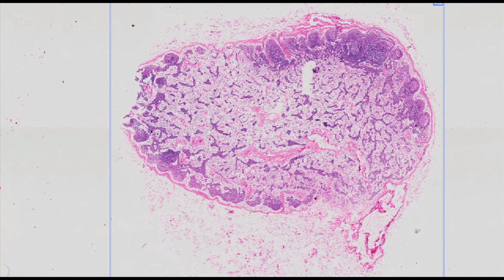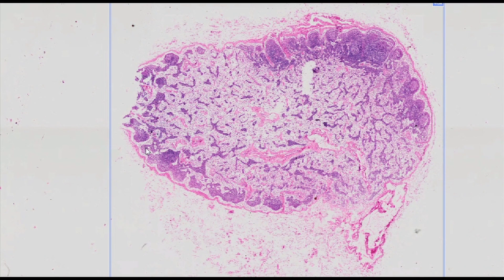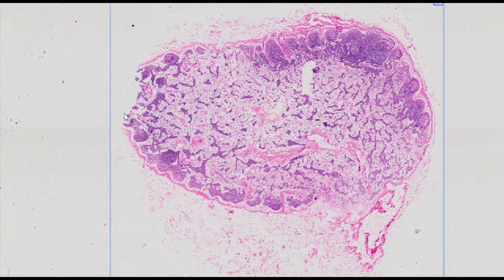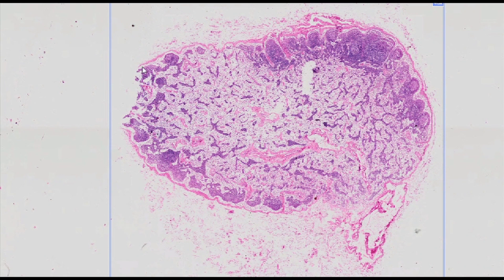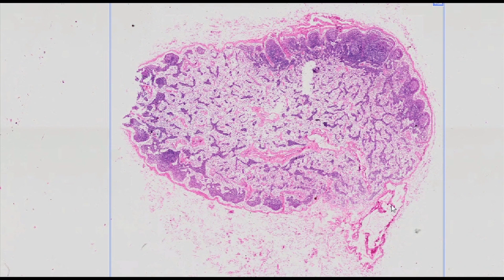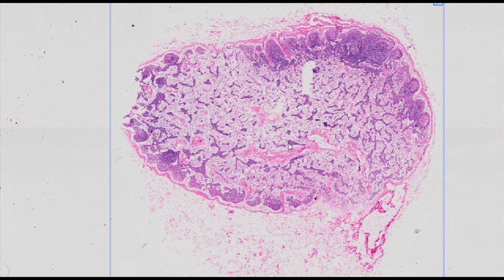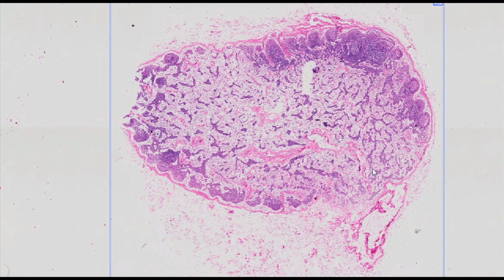Lymph node, H&E staining. A lymph node has a characteristic bean shape, a convex side, and an opposing concave side or a hilum.